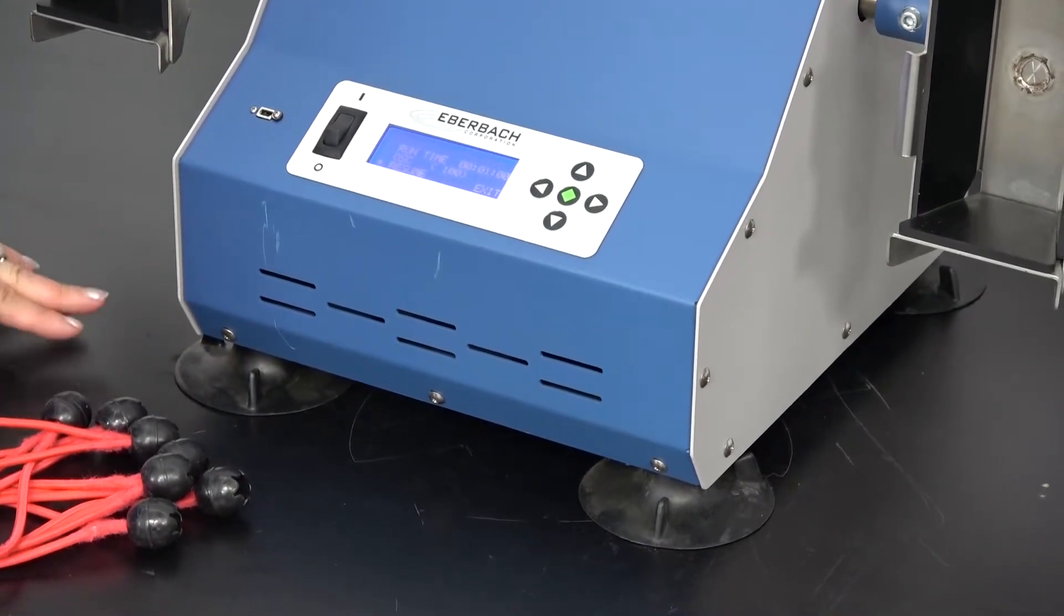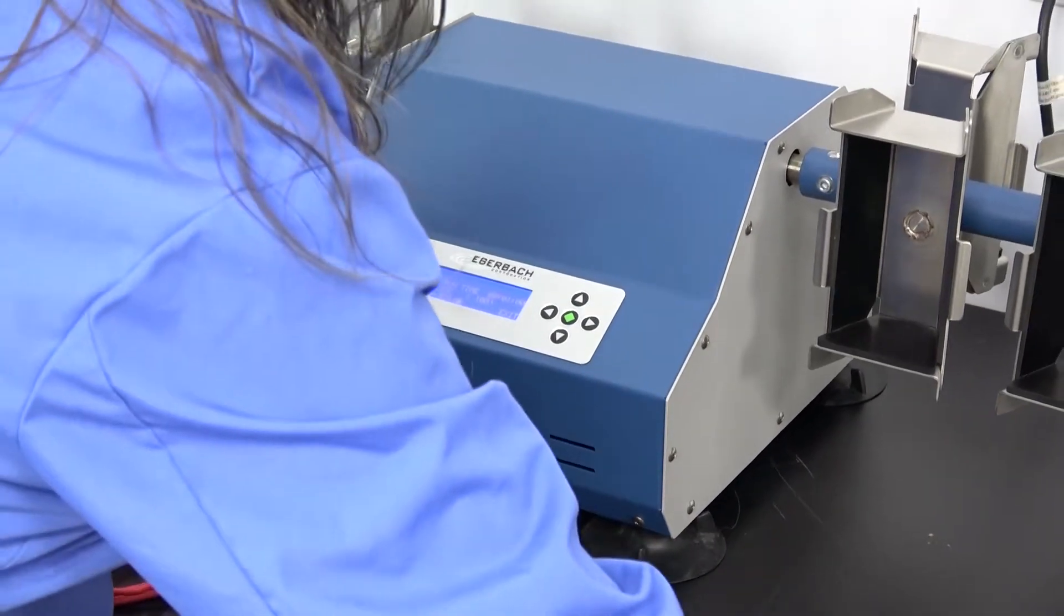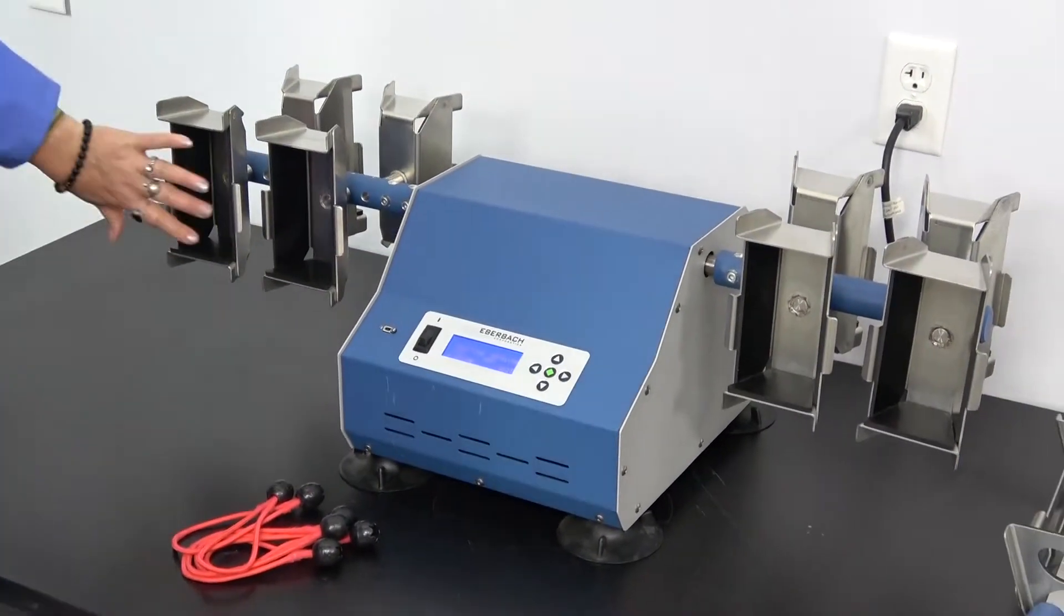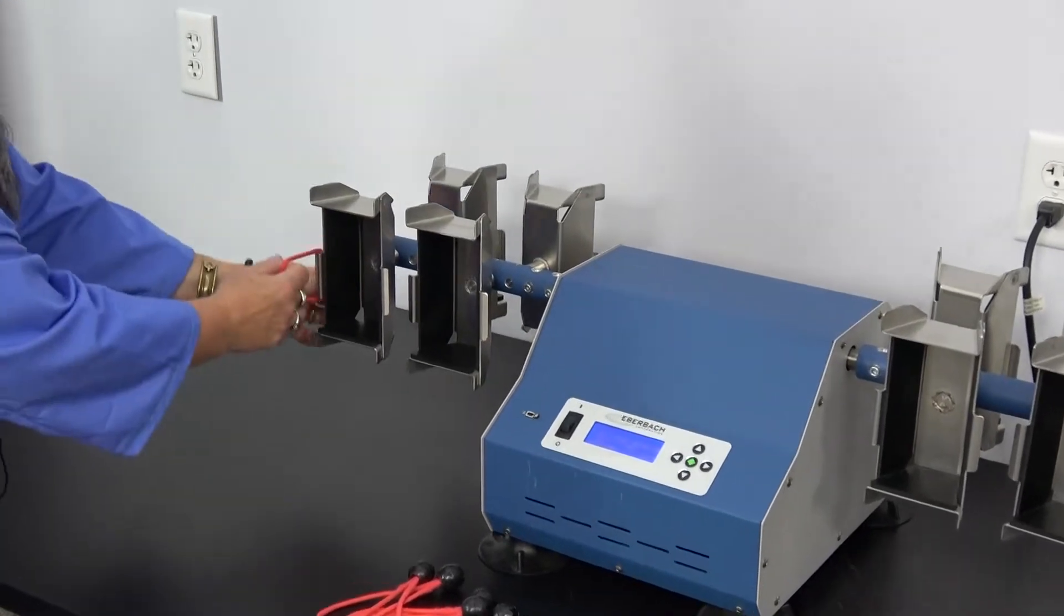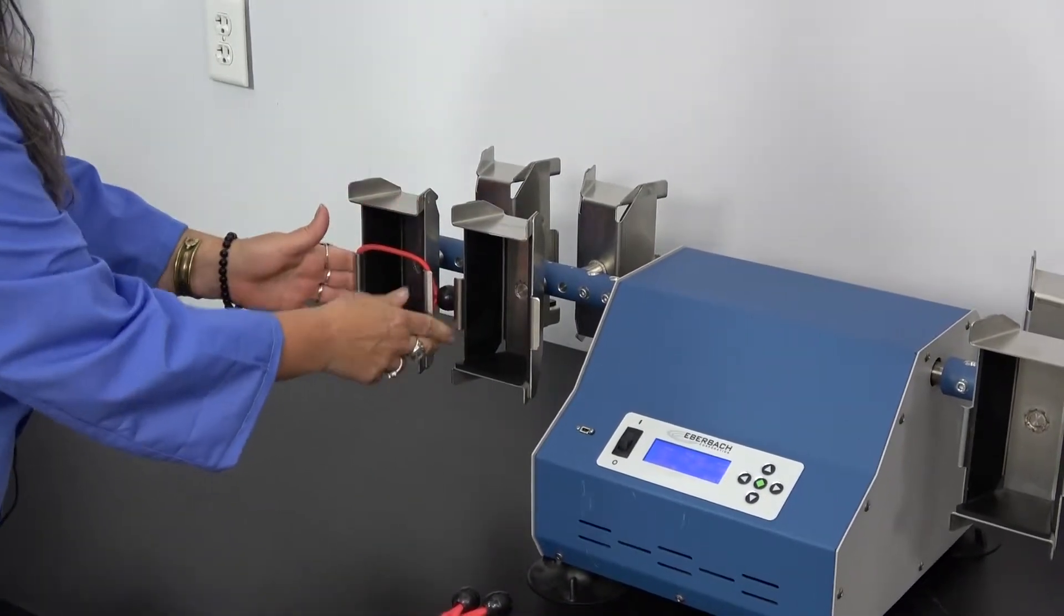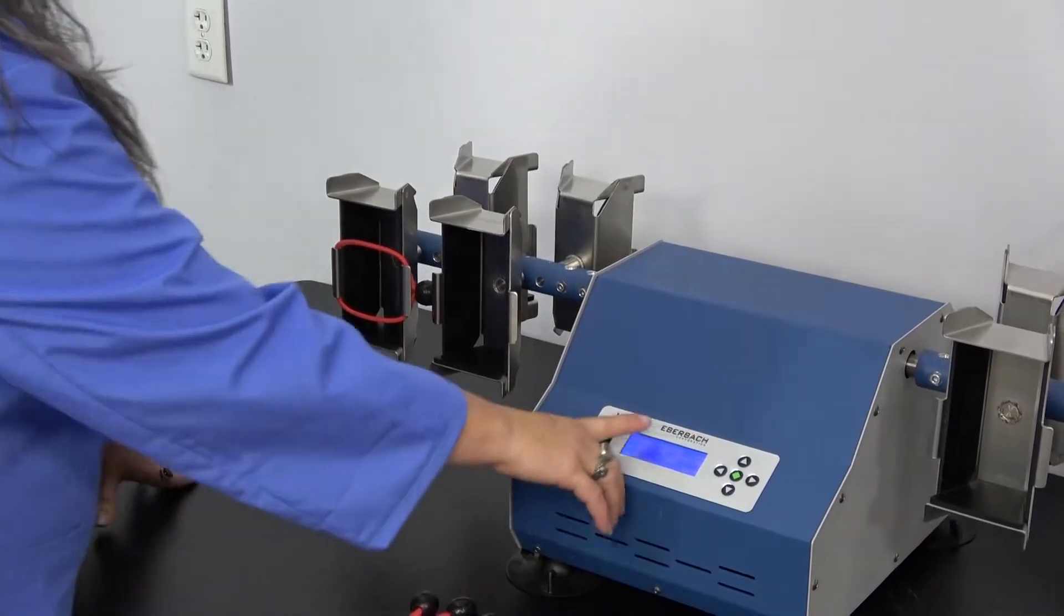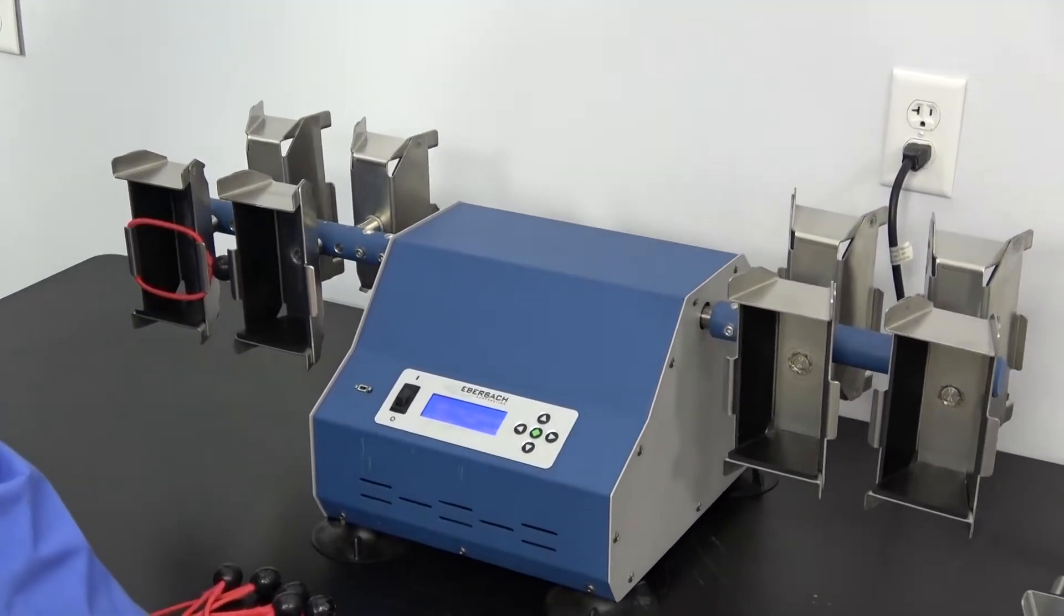We'll just run you through a little sample of how well it runs. You would put your jar or your flask or your container right here, and you would strap it in with the cords. These cords do come with this particular unit. I have it already set, so I will hit the green button in the middle to resume.